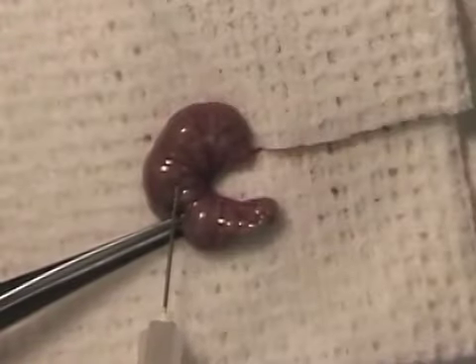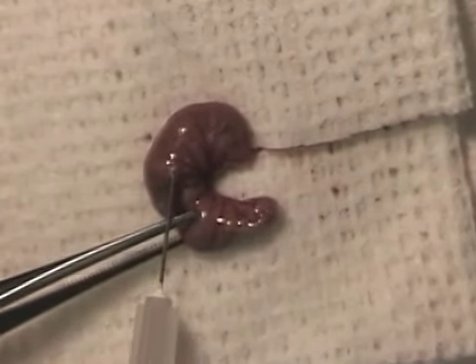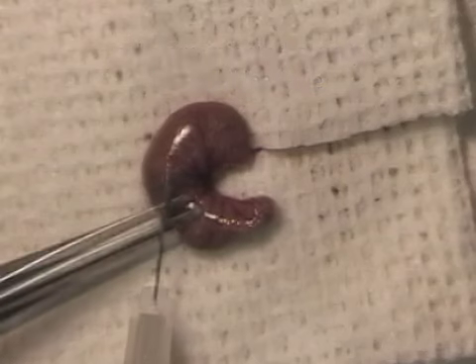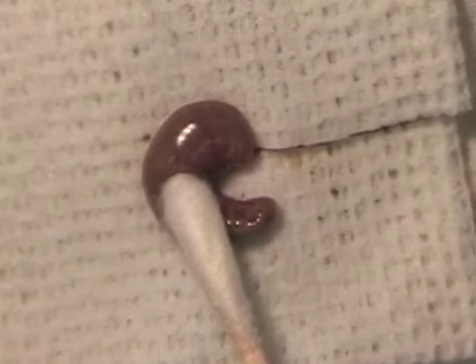A 27 gauge or finer needle is used to inject a 50 microliter volume of cells into the cecal wall. The needle is removed. The injection site is inspected to ensure no leakage.